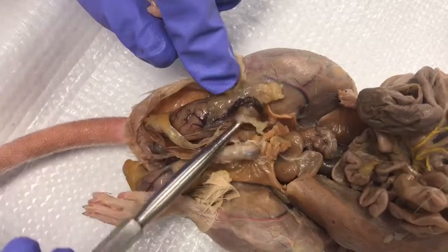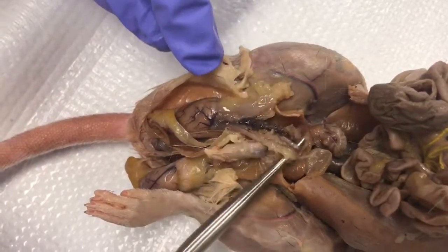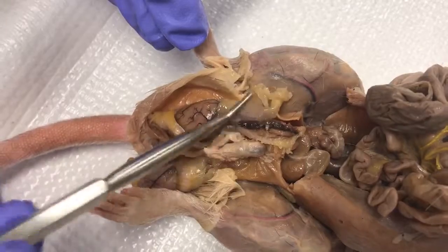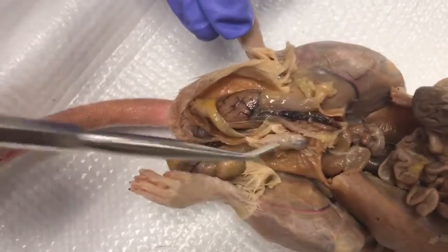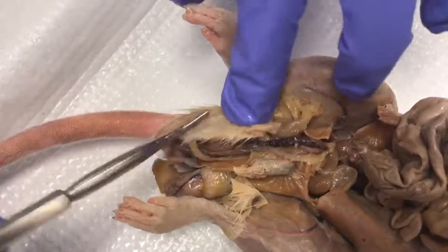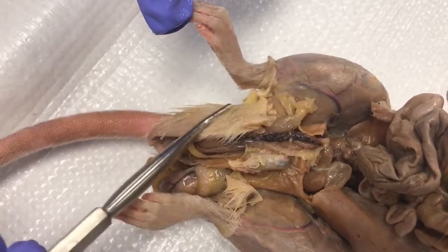Right here we have the vas deferens. Right here is the epididymis. Right here are the two testes. Here is the penis. And this outer skin region that covers the testes is called the scrotum.